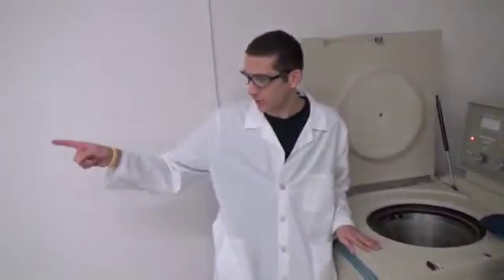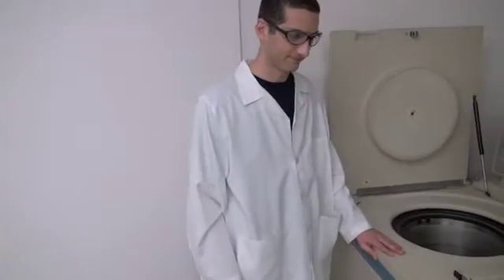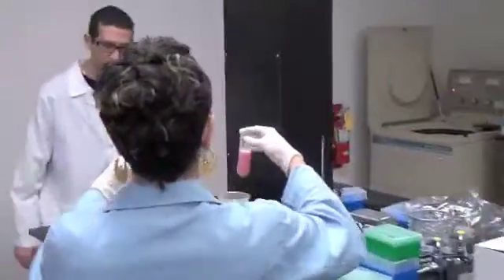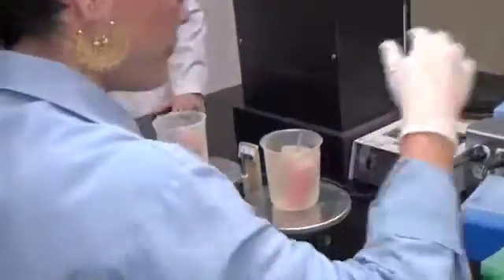Challenger! Slots 1 and 13. I don't need to write that. Master TA has now just told the Challenger which slot numbers of the rotor that her samples are in. I hope Challenger was writing those slot numbers down.